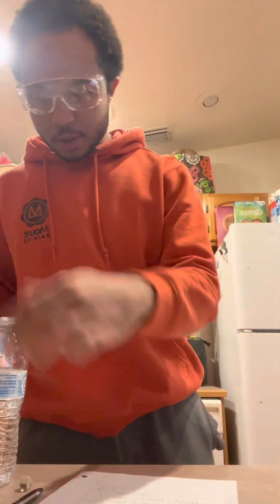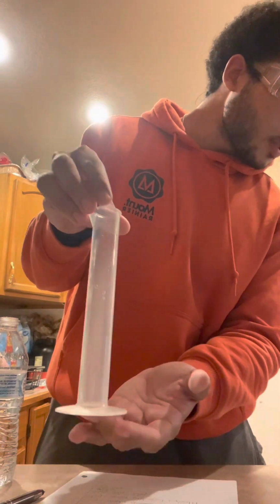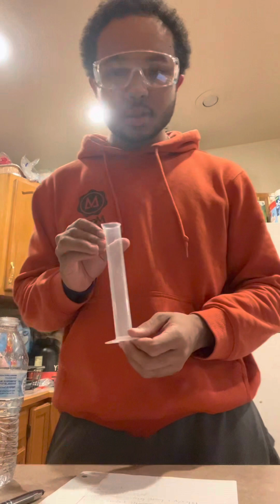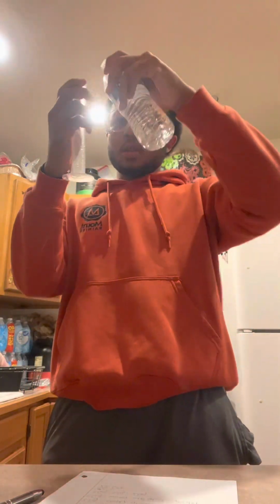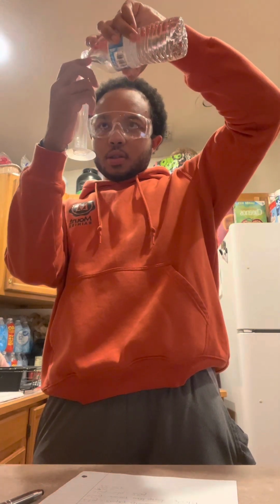Okay, and I got all my materials right here. So first, we take our graduated cylinder, and it says pour 25 milliliters of water into your graduated cylinder. And I got my water bottle right here. So we're gonna pour 25 milliliters.